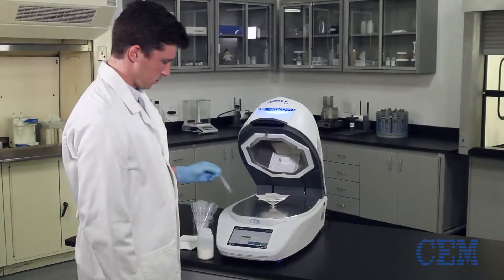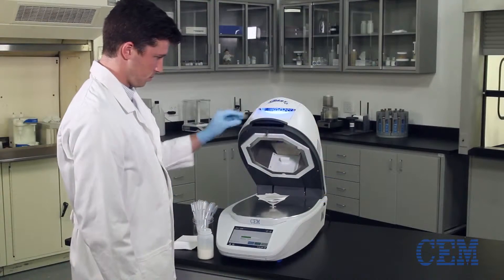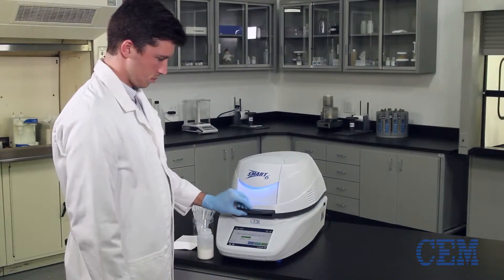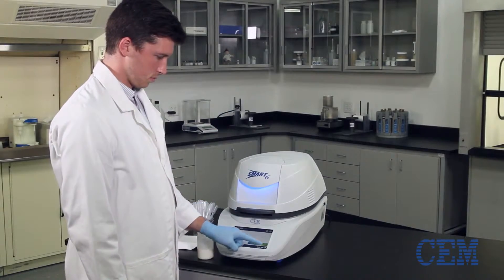Once your sample has been properly applied, place the sample and pads back on the balance, close the lid, and press Start.